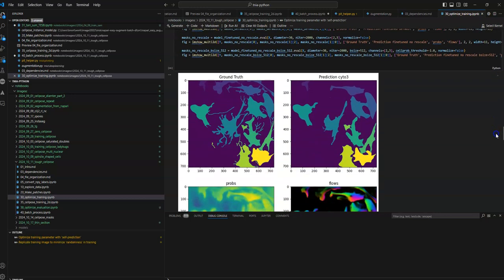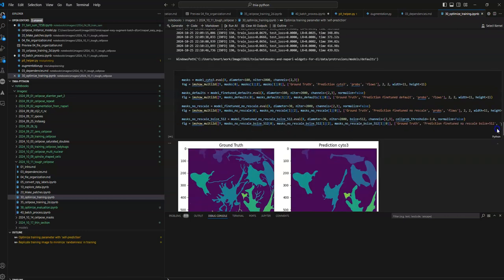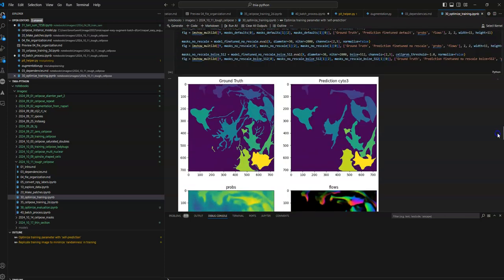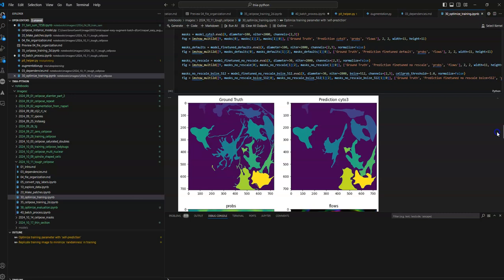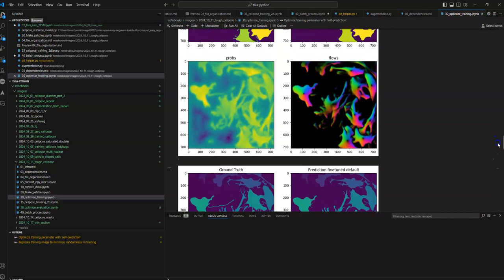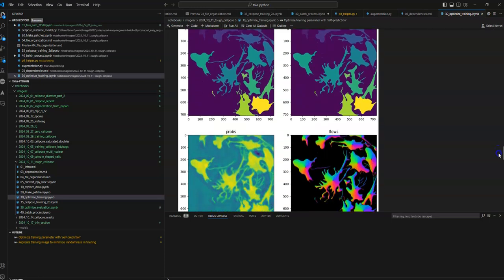For example, the first thing I did is try to predict it with Cyto3, and you can see it's not really getting the protrusions. In these little plots, Cellpose actually predicts probabilities and flows, and then the masks are generated from those. So I'm showing ground truth, prediction, then the probabilities and flows. The first one is Cyto3, and the second one is retrained with just the defaults, not really tweaking the training settings at all.